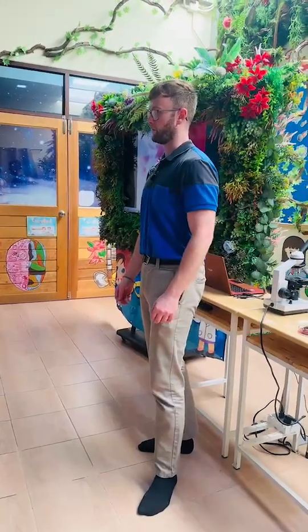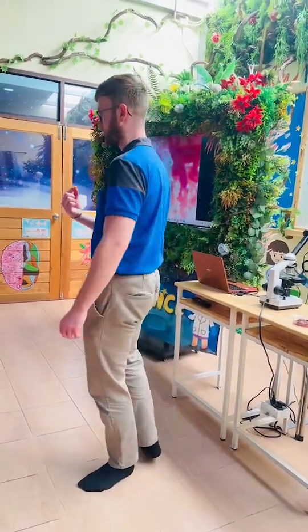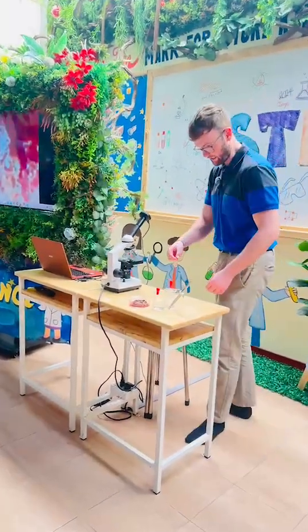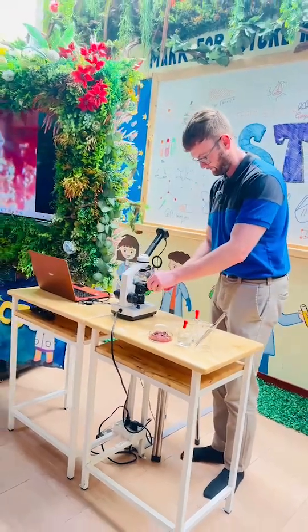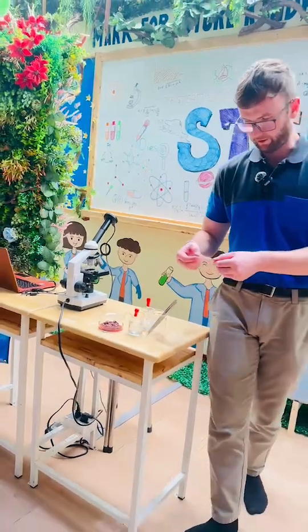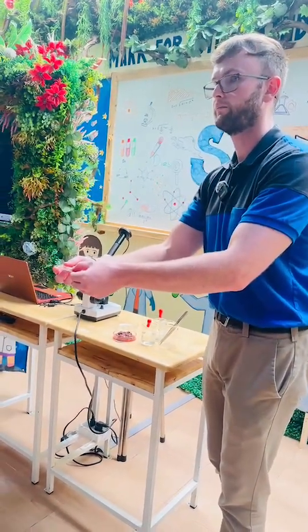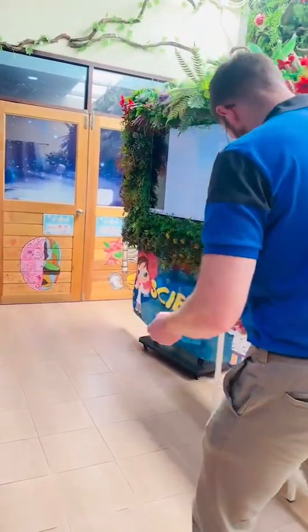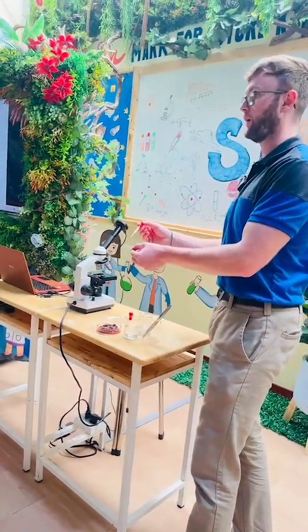What we're going to do today is we're going to look at animal cells. So I'm going to show you what we do and how we prepare the experiment. We take our glass presentation dish, we take some water, and we put one drop of water on top.